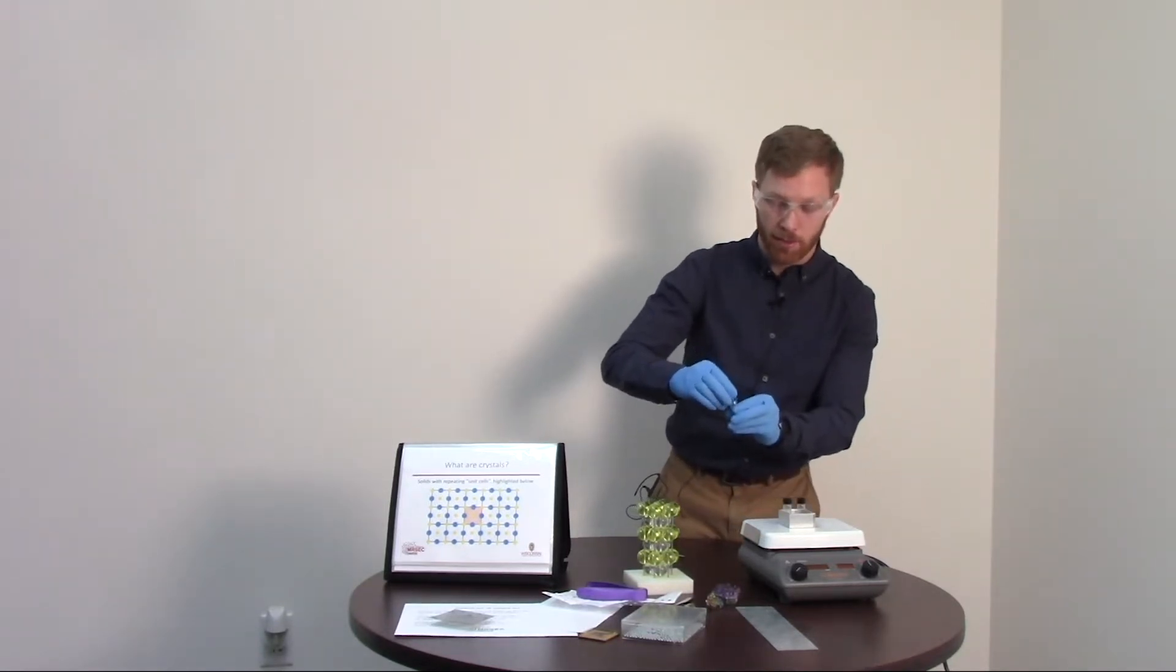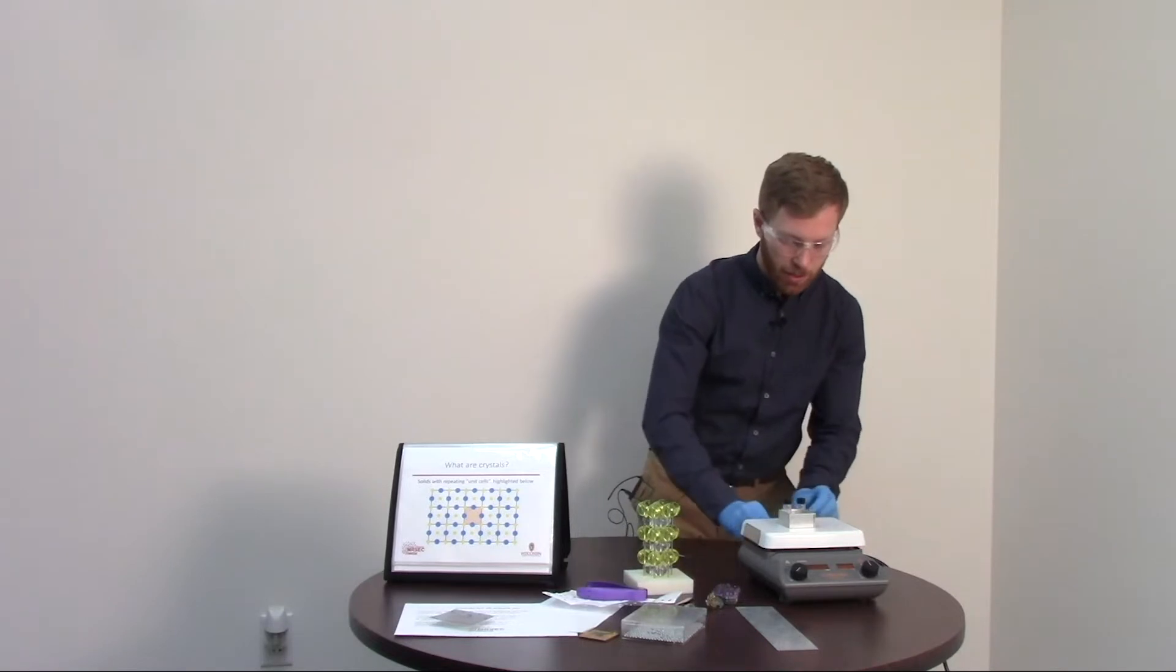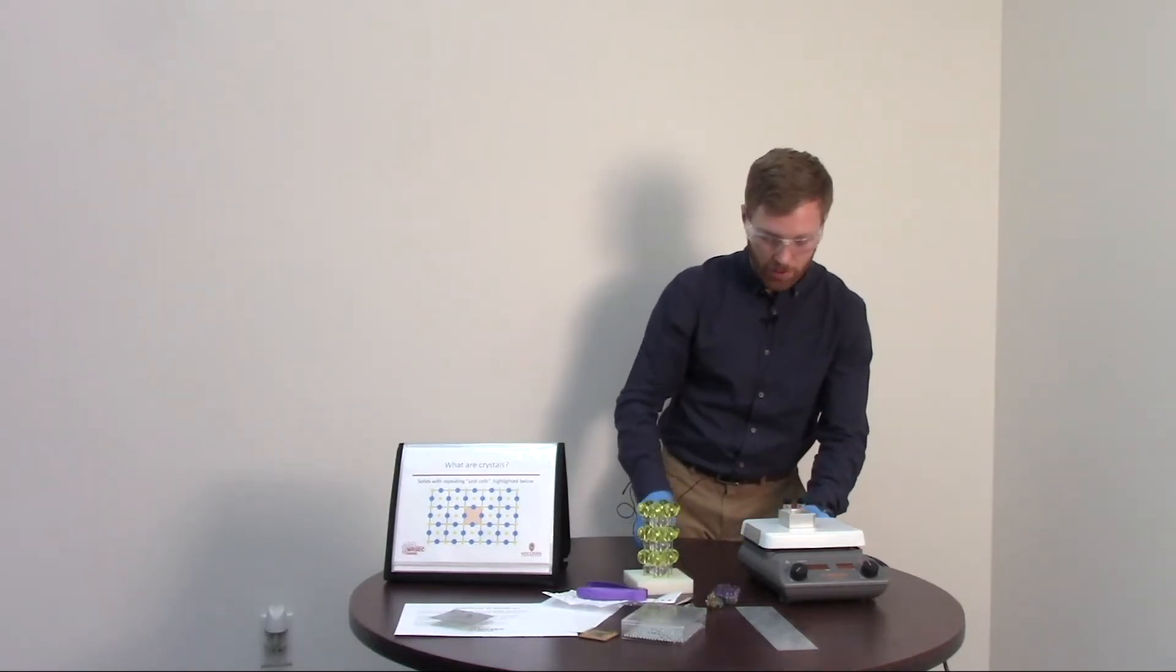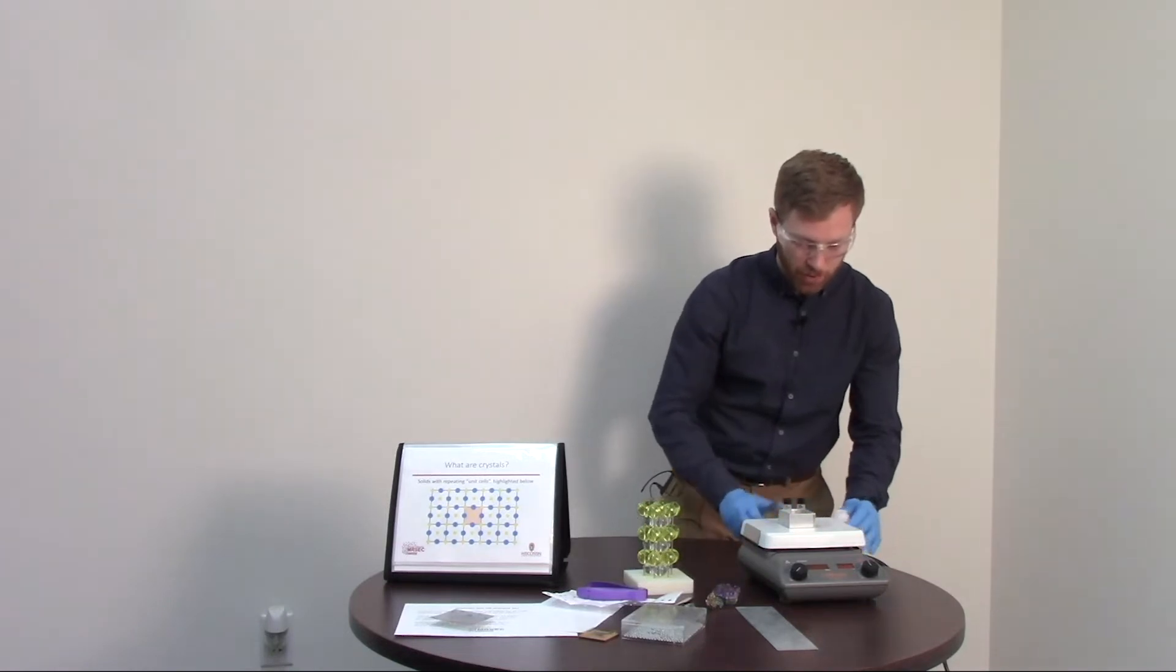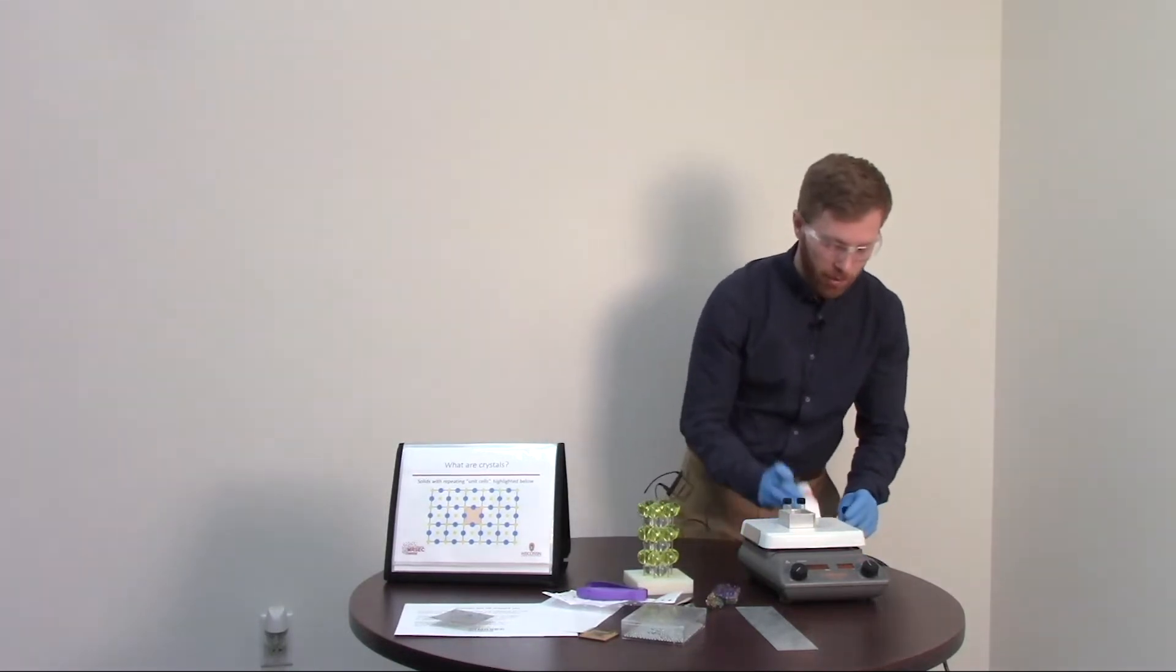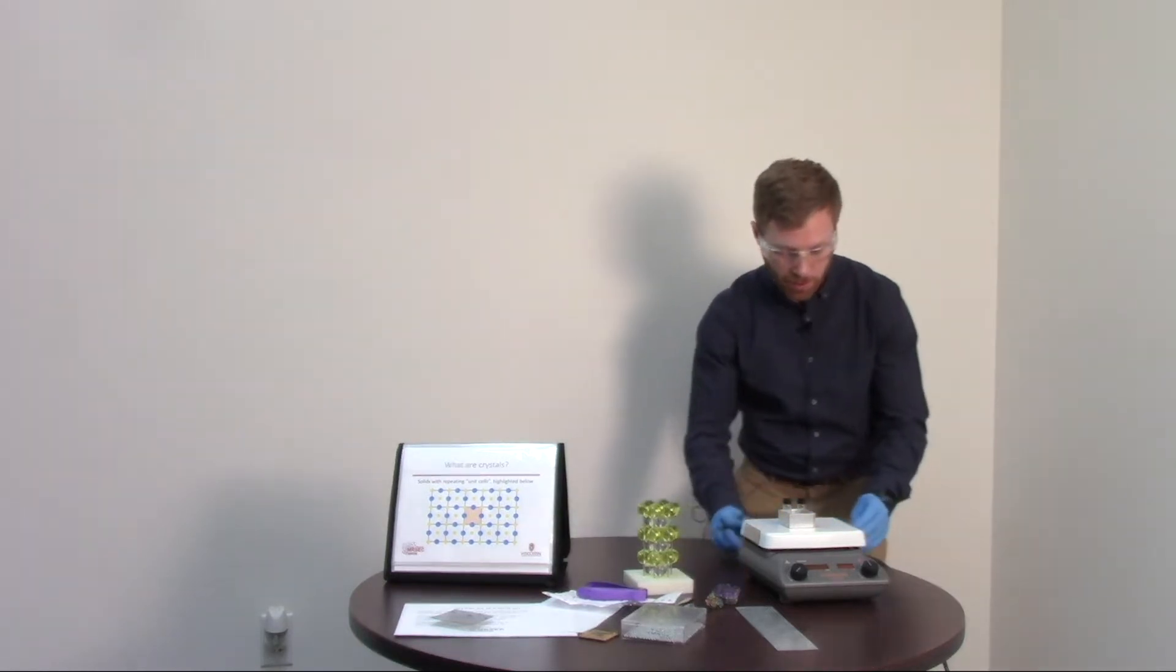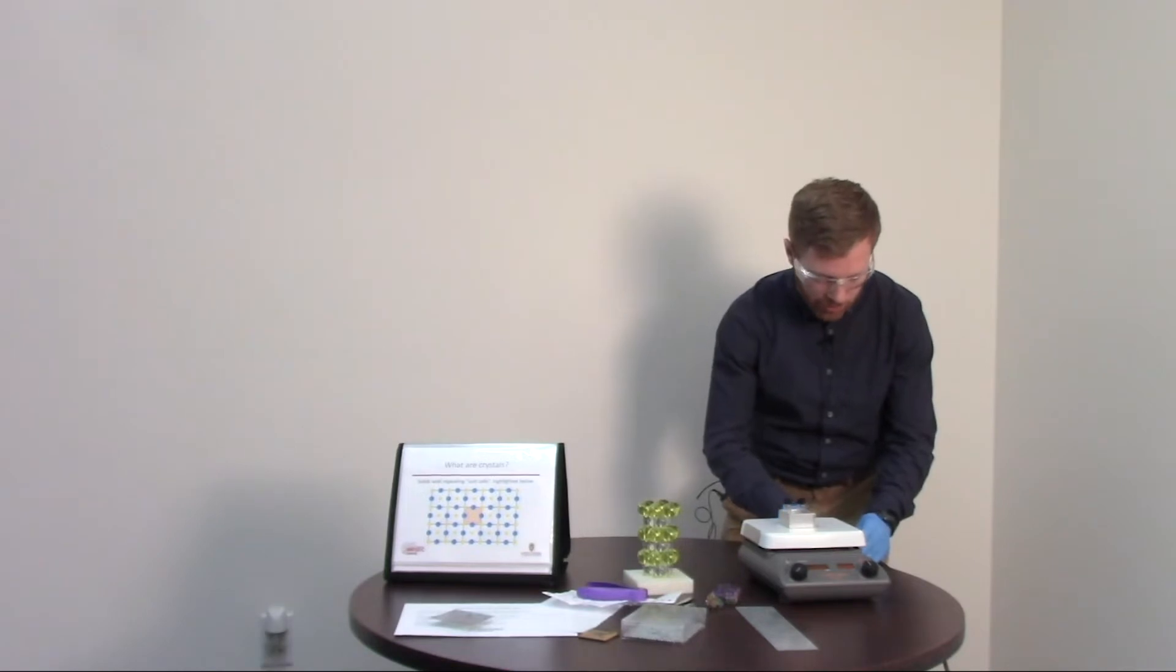So I'm going to handle this because this was on a hot plate and this chemical here is a skin irritant. So I've got some gloves on. So what I'm going to do is I'm going to take a little crystal from the base vial and I'm going to drop it into here and it's going to be a little bit of a seed crystal.